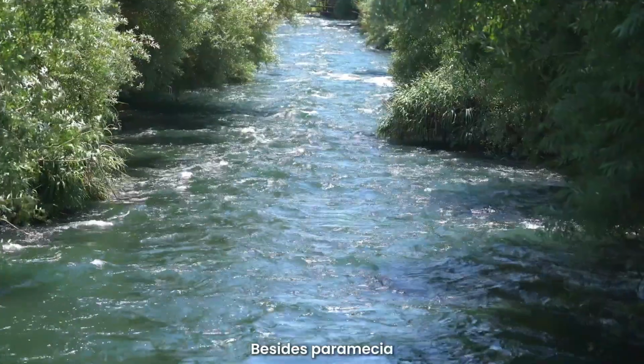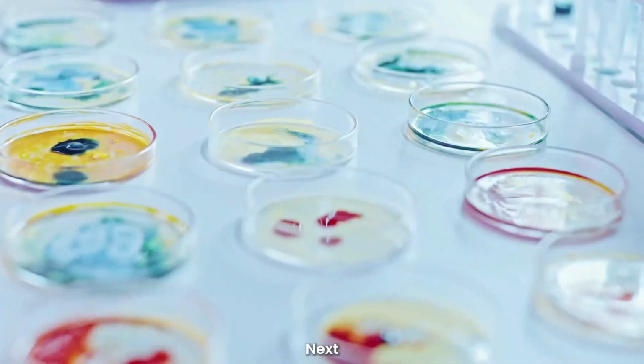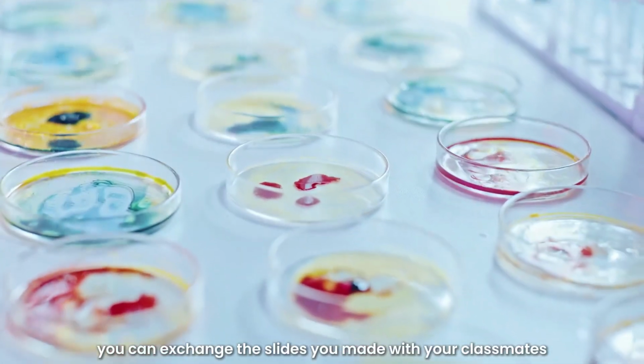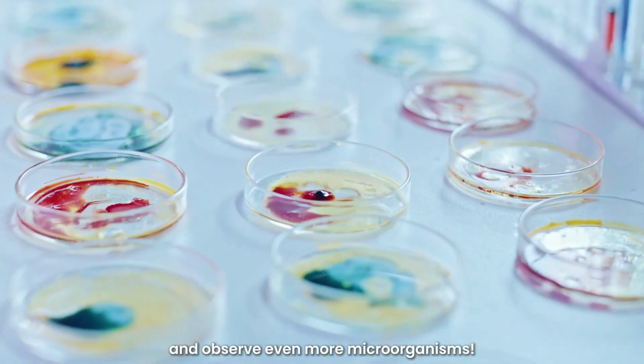Besides Paramecia, many other microorganisms are in the water waiting for us to discover. Next, you can exchange the slides you made with your classmates or use different water samples to create new slides and observe even more microorganisms.